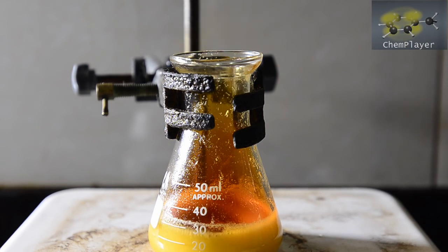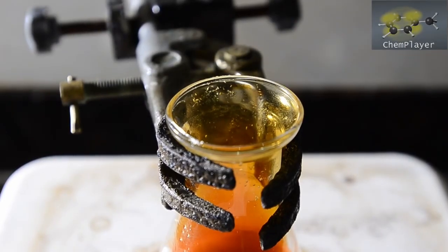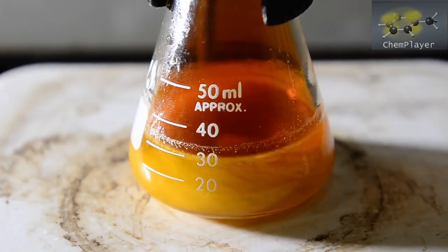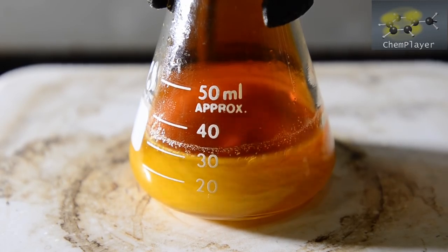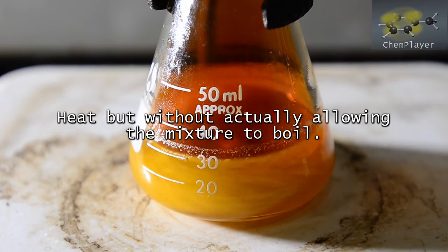Now that the solid is all loaded, we're going to start heating gently. We want the temperature to get up to about 70 degrees C. As the reaction takes place, brown fumes of nitrogen dioxide escape from the flask. You can see the solid benzoin in suspension in the mixture. Keep heating at 70 degrees for about 15 minutes.